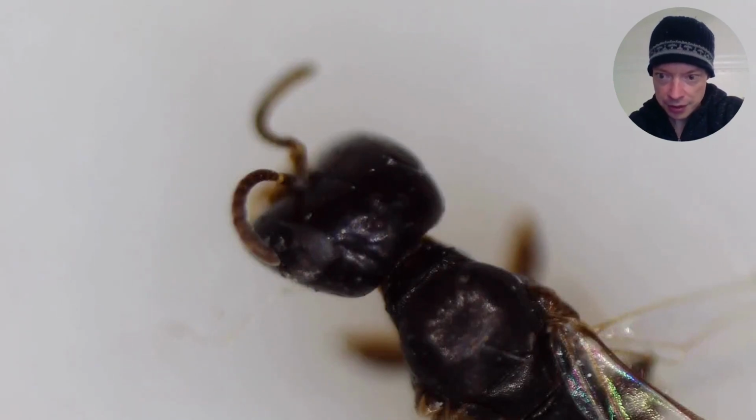Hi, welcome to another video, and today we're going to be exploring the anatomy of a small parasitic wasp.